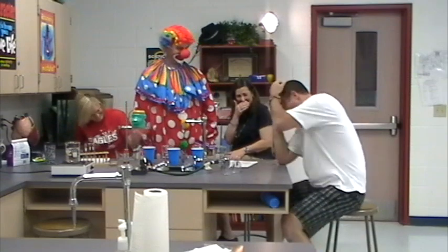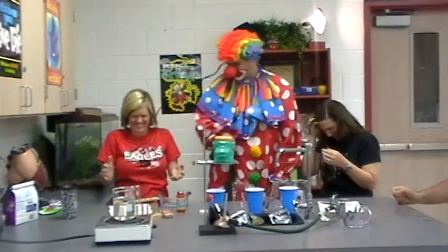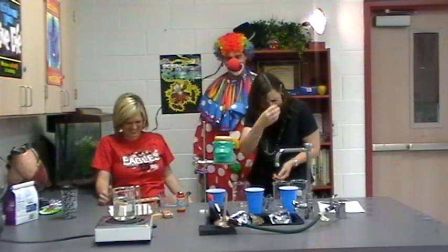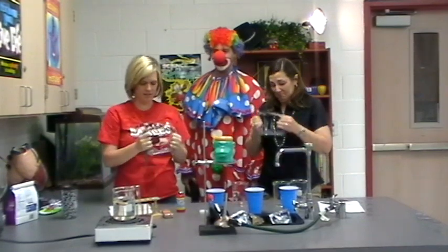Now, we need to learn one last thing about lab safety, and that's the use of eyewear. You never know when a dangerous chemical can splash. Whatever! What you talking about, boy? None of that stuff ever gets in your eyes anyway. I don't know what you're talking about. What you talking about? Oh! It burns! It burns! Wait a minute. It burns! You're mocking me. You don't think water hurts? What are y'all laughing at? Homie, don't play that. I don't think so. Now, if you think goggles ain't important, put yours on. I'm about to show you what happens if you use bad glassware.